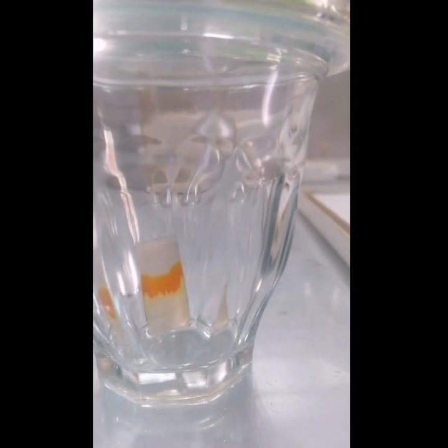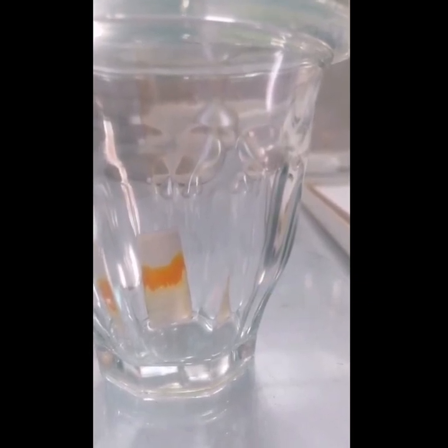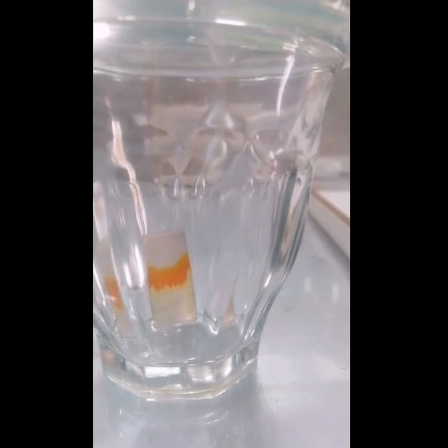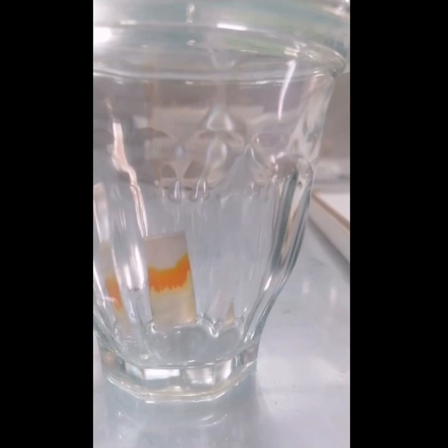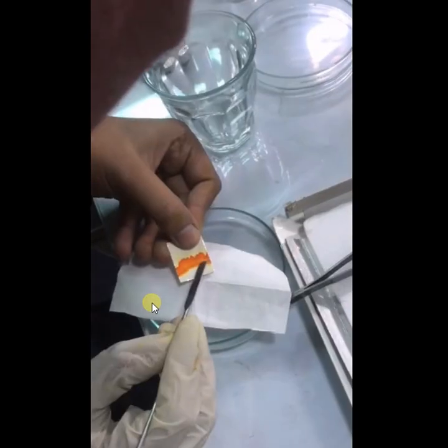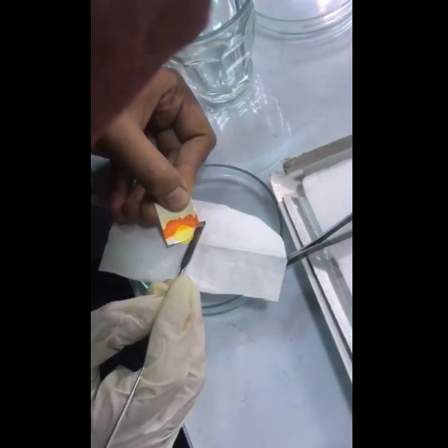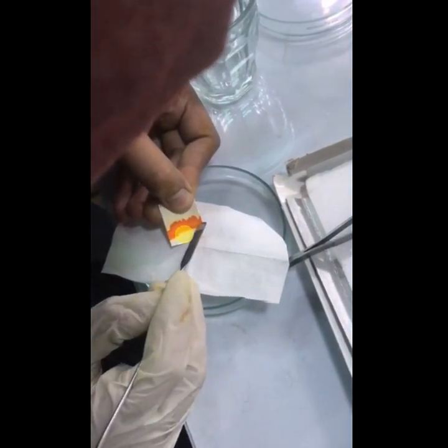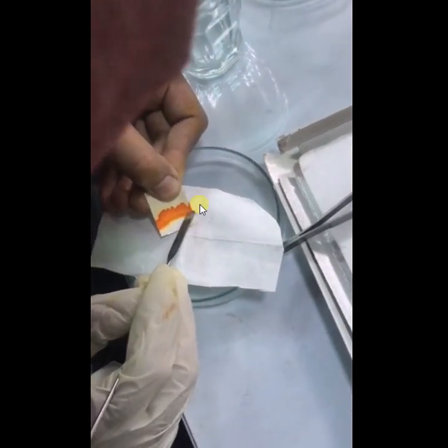I placed this and my sample separated. When I placed my TLC under the UV lamp, I saw some blue spots which are irrelevant. So I simply scratched my product that is in yellowish color.